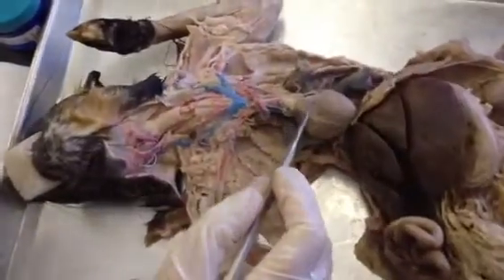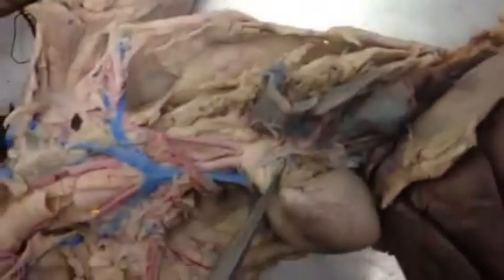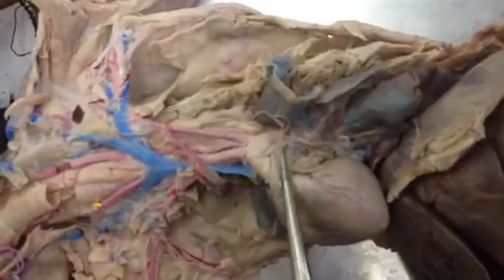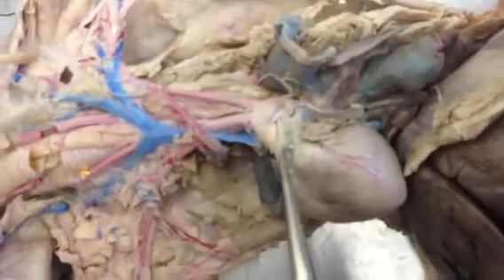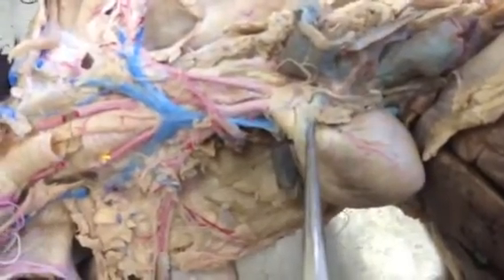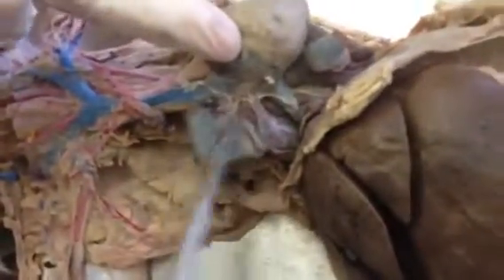Okay, so we're going to start here. The coronary arteries are right over the heart. The pulmonary trunk artery, on this one, is a little deceiving because it's dyed blue, but the pulmonary trunk artery is going to come right outside, right here like this. It's leaving the right ventricle. And then we also have pulmonary veins. I'm going to just do the veins as well here. That's right here. They're going to be connected to the pulmonary veins.